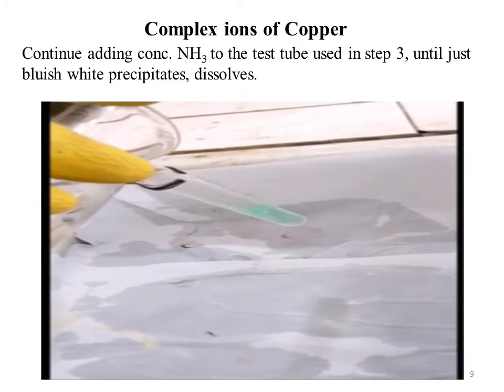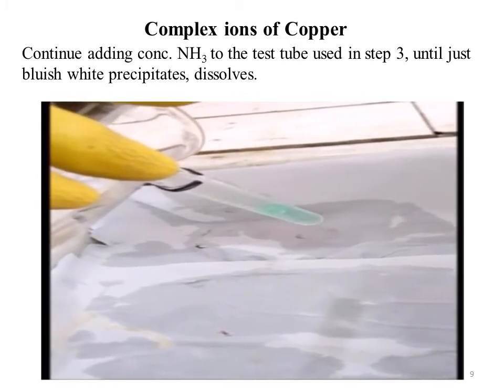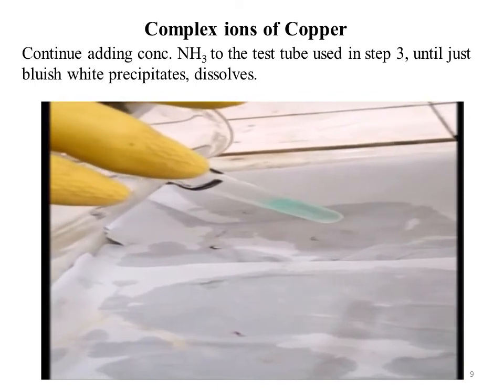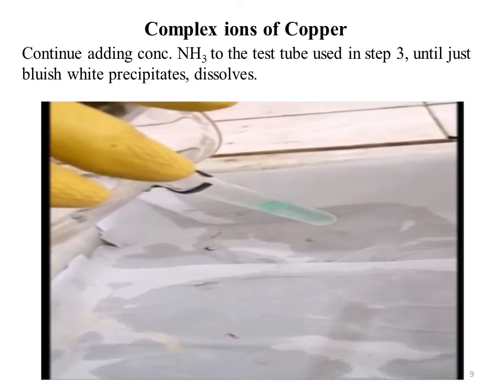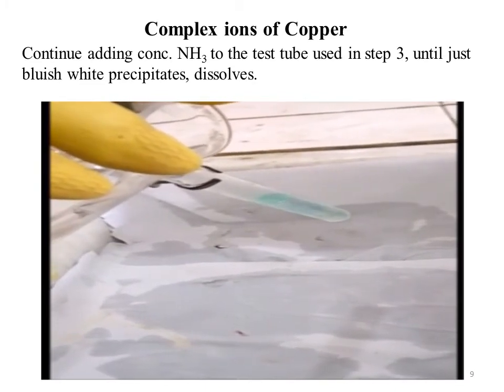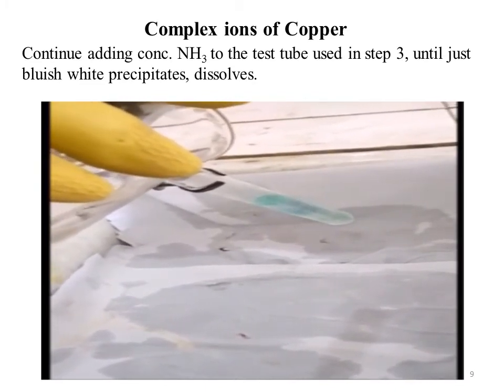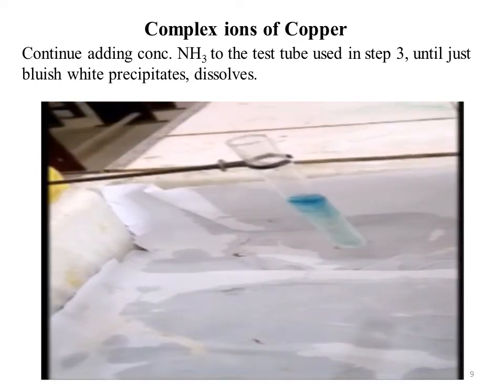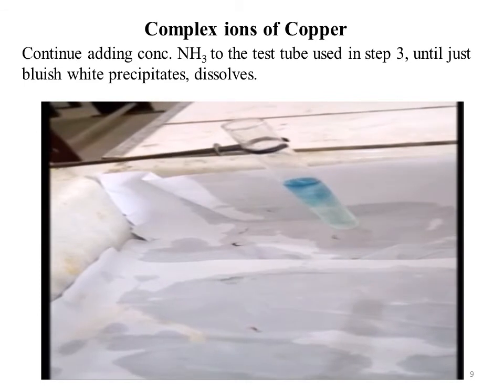You have to add concentrated ammonia to the test tube that was used in step 3 until the bluish white precipitate dissolves. Here in this video you will see actually what we have to do, we have to add ammonia in excess. In the video you will see that when ammonia is added slowly at the start, there is an appearance of a bluish white precipitate that dissolves in excess of ammonia.